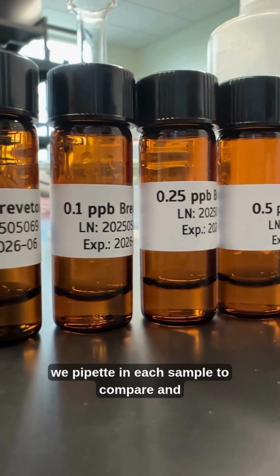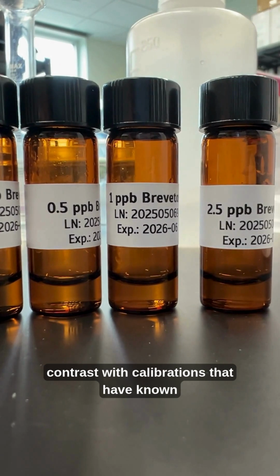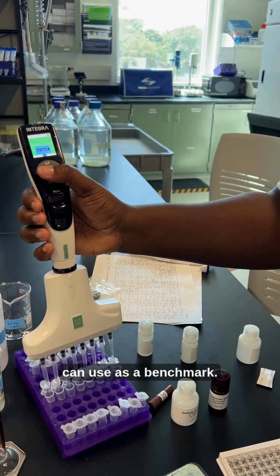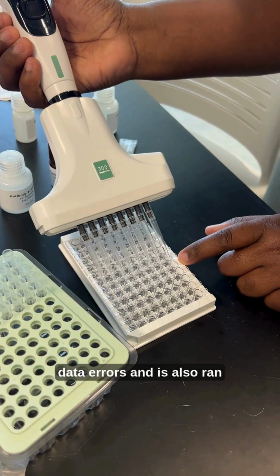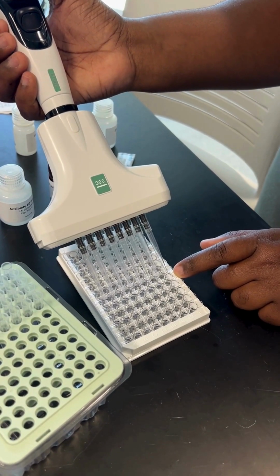First, we pipette in each sample to compare and contrast with calibrations that have known concentrations of brevetoxin, allowing us to create a standard curve we can use as a benchmark. Each sample is run twice to account for data errors and is also run alongside control and blank samples.